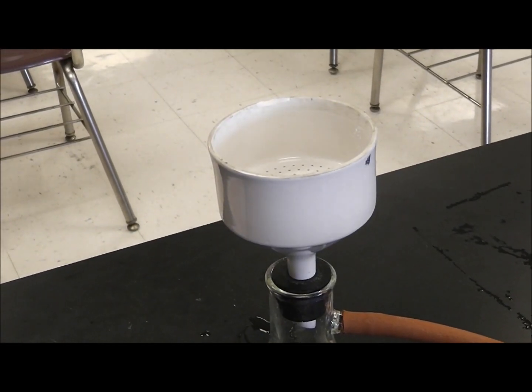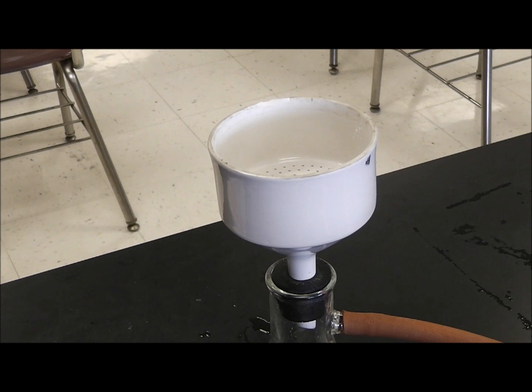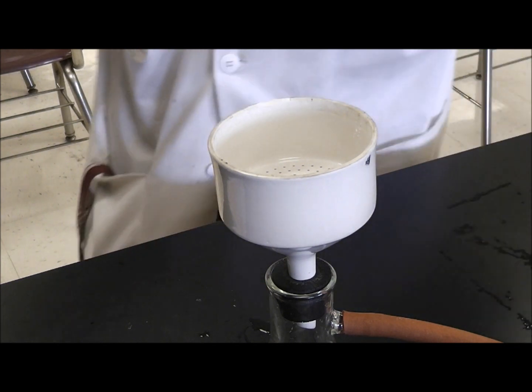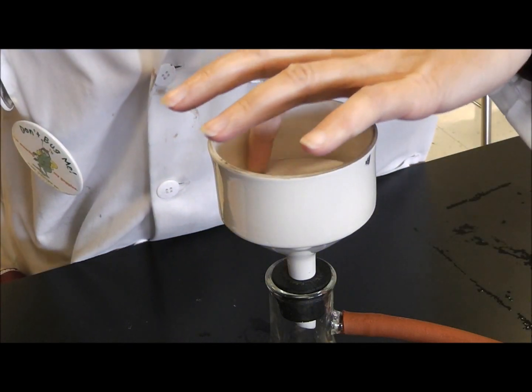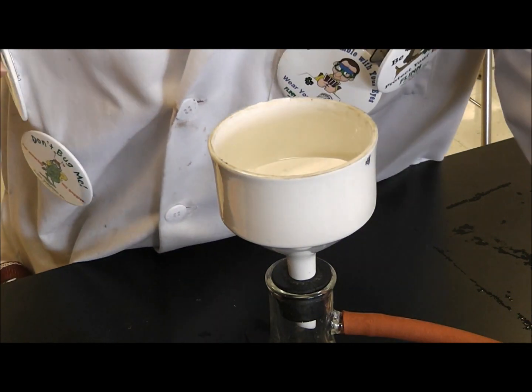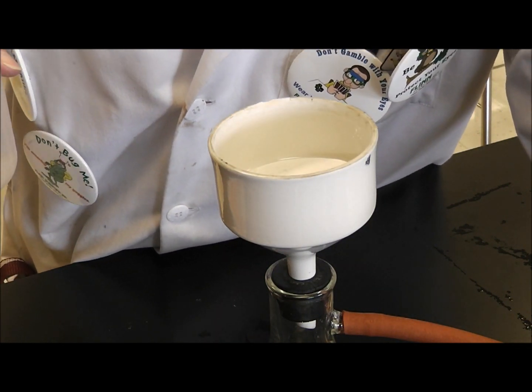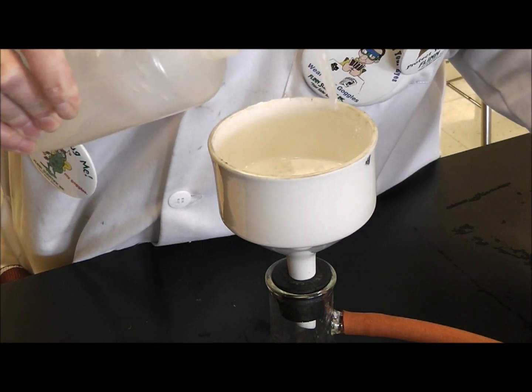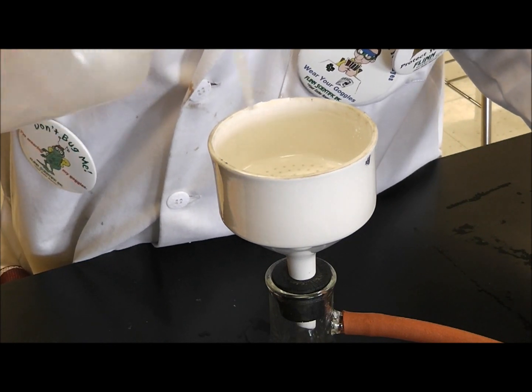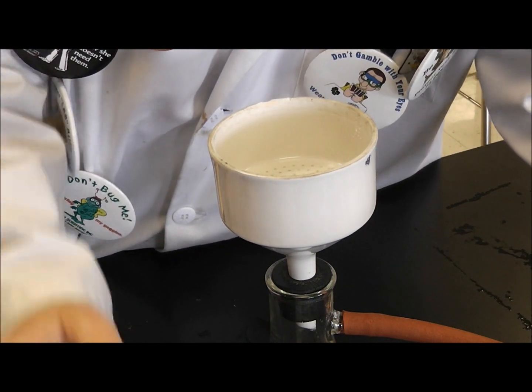Okay, so here is what I am going to do right now. This is the Buchner Funnel, and it works by hooking up to the water system. Put the sink, turn the water on. I am going to put a little distilled water in there. It is sucked down.